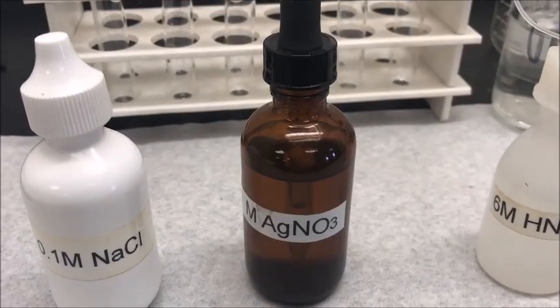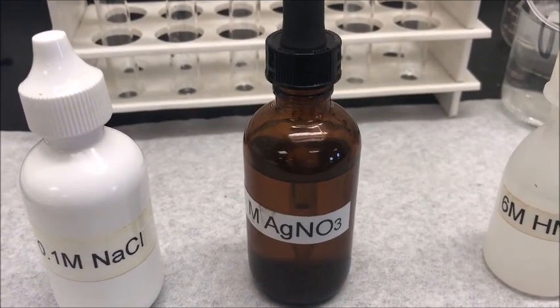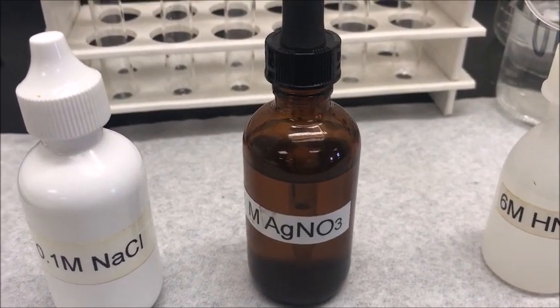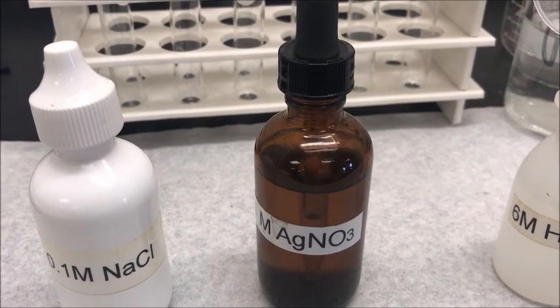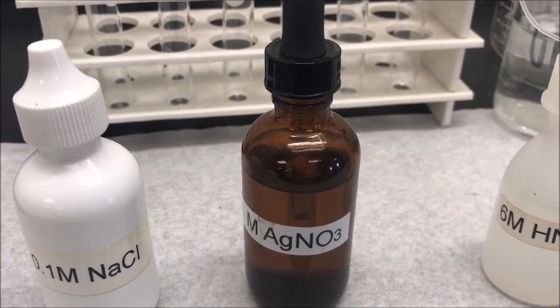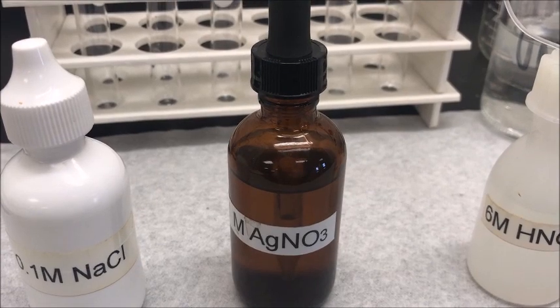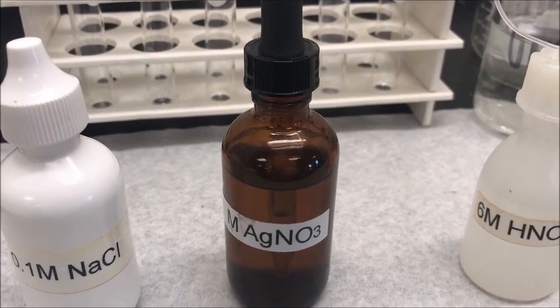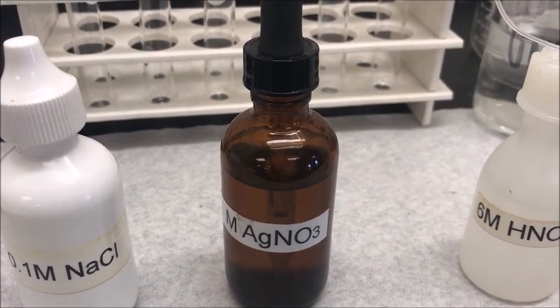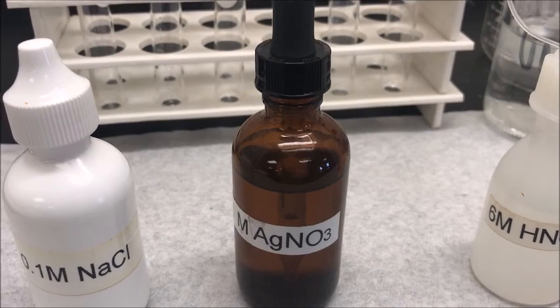Next, we test for anions. The anions we are going to test in this lab are chloride ion Cl⁻, sulfate ion SO4²⁻, and carbonate ion CO3²⁻.